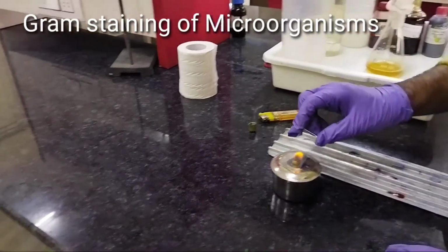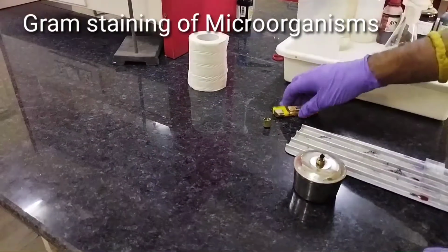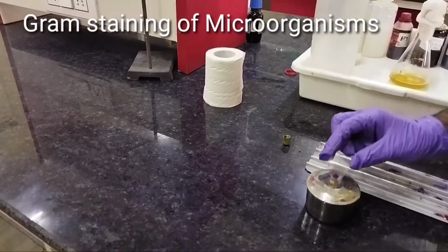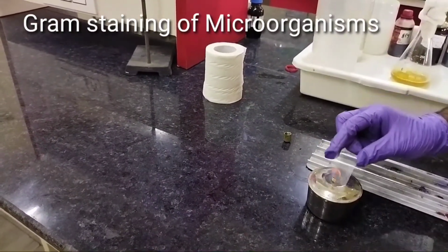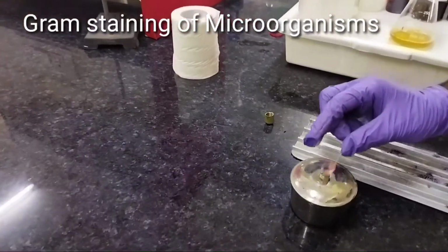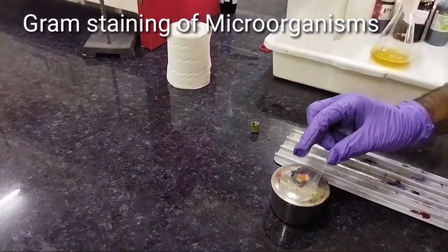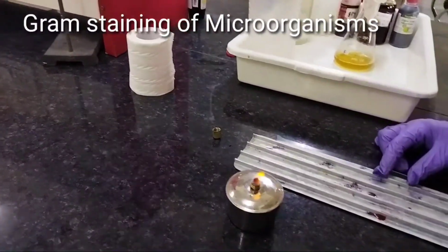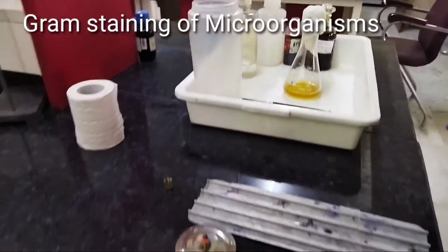As the smear is formed, we will have to heat fix it. We will have to fix the smear so that the bacteria will be fixed to the glass slide. It's a very important process, so we will have to do it very gently. Now the bacteria are fixed to the glass slide.